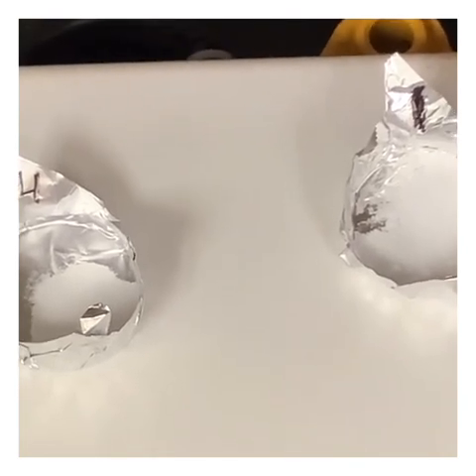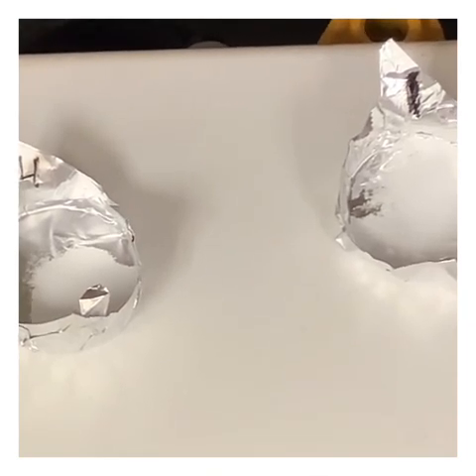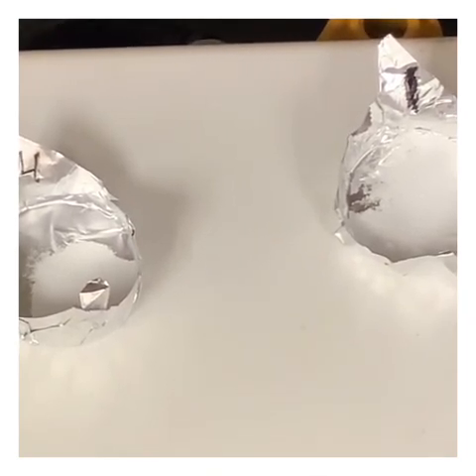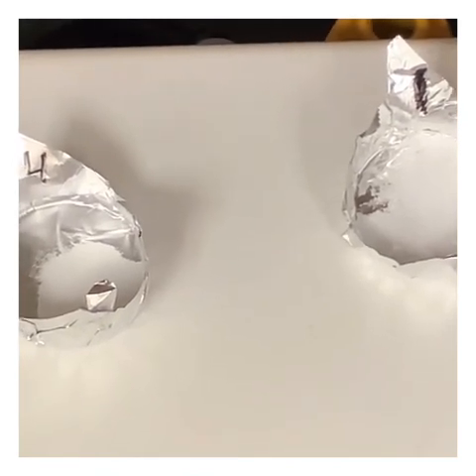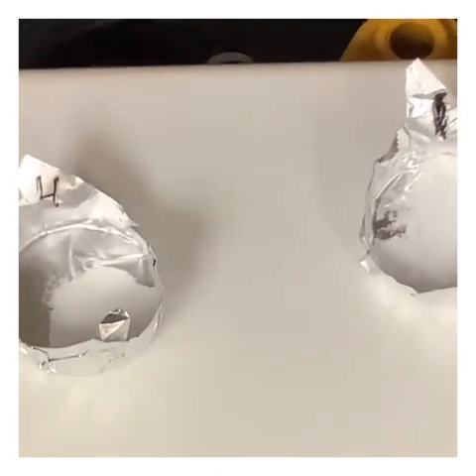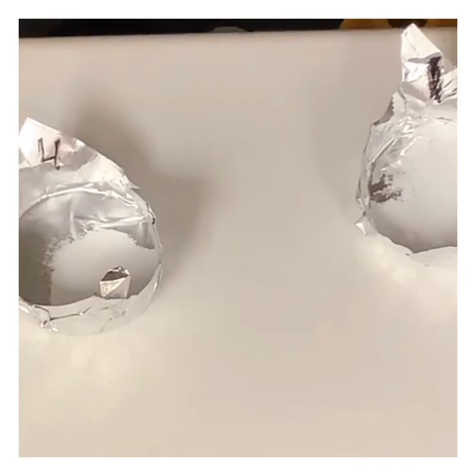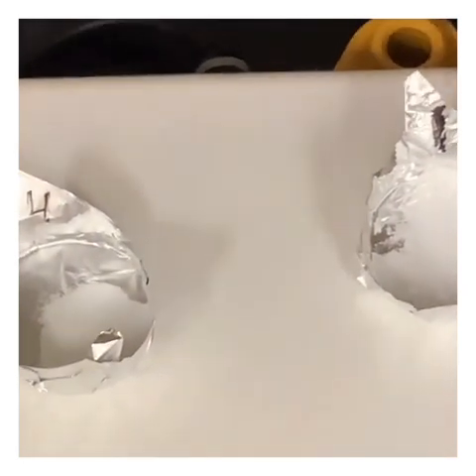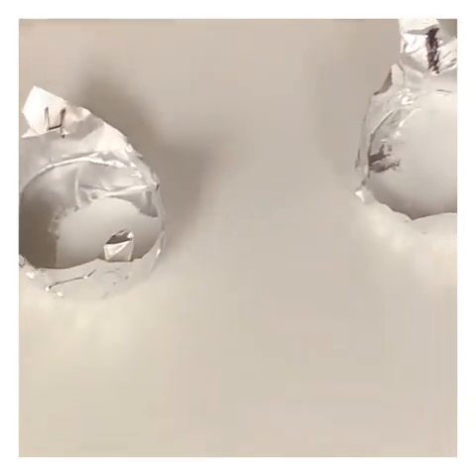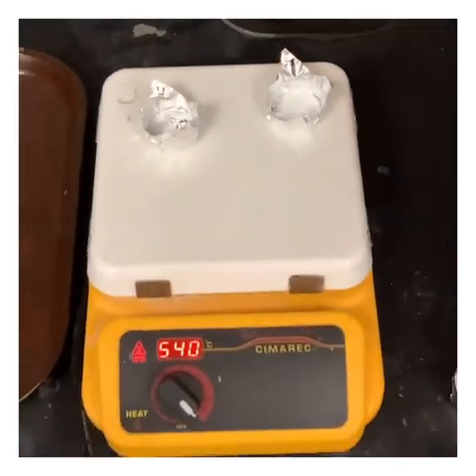And these two are just kind of sitting there. Yep, I'd say that those are not changing. They're getting nice and hot. At this point, they've got to be right around 540 degrees, but 1 and 4 just are not melting. So I'd say 1 and 4 not changing on us, staying the way we saw them.